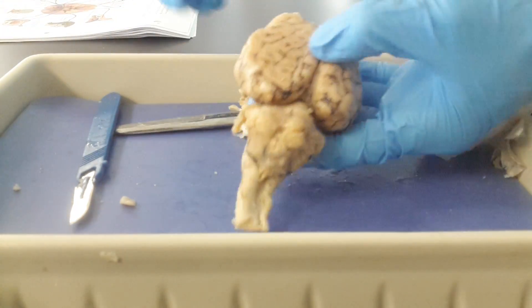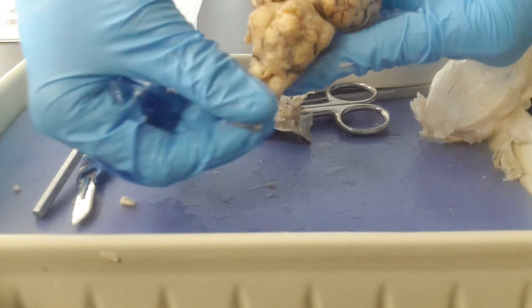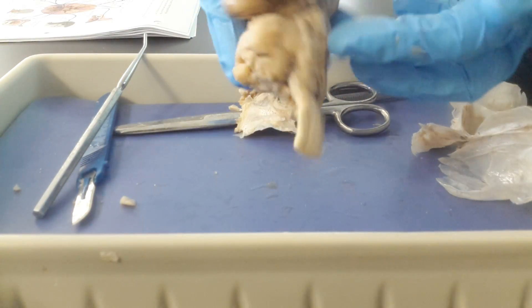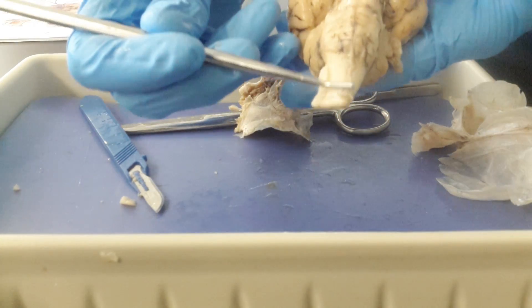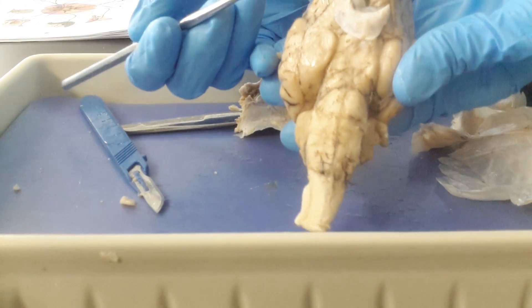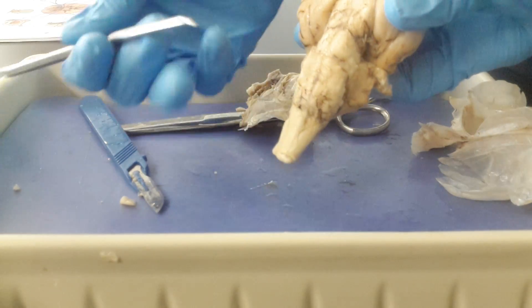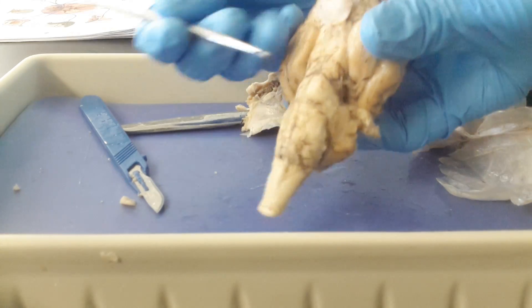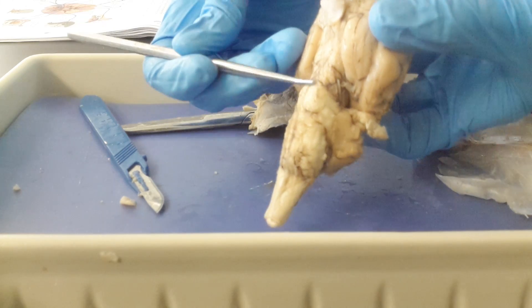When we look back here, we see that extending down from the cerebellum, we see the very top portion of the spinal cord. If we flip over to the underside, we go up from the spinal cord and we can see the different regions of the brain stem. Remember that the bottom region of the brain stem connected to the spinal cord is the medulla oblongata. Right above the medulla oblongata, you see these little bulges here — that's the pons.